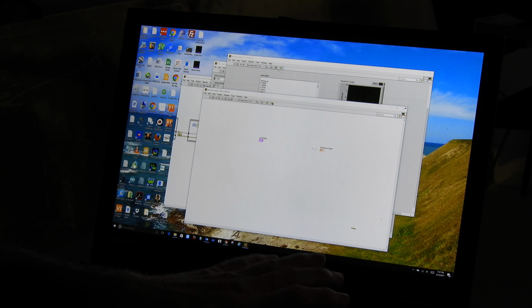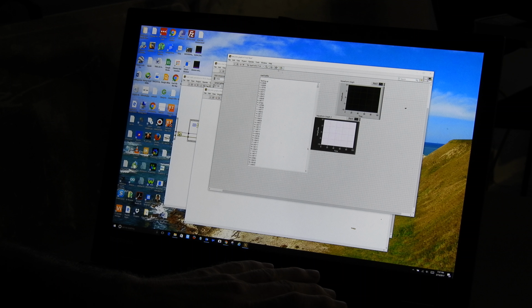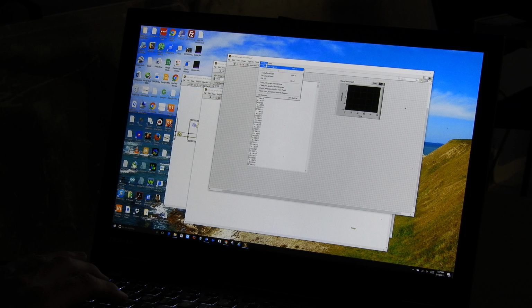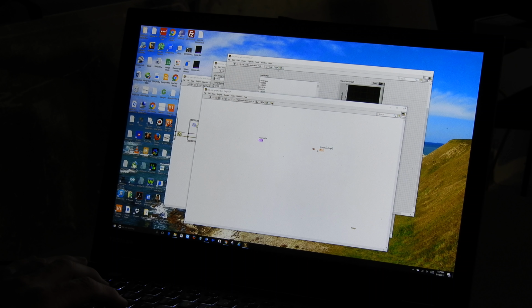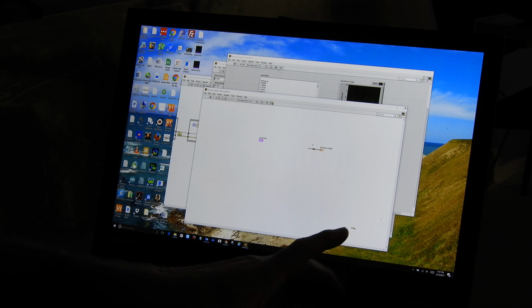Let me go ahead and erase this. And instead of creating a constant, I'm going to say create control. Okay, so we'll go over here to control. Oh, no, that is not the way we want to do that. All right. I take that back. We're going to do what we did before. Actually, no, we're going to do this.